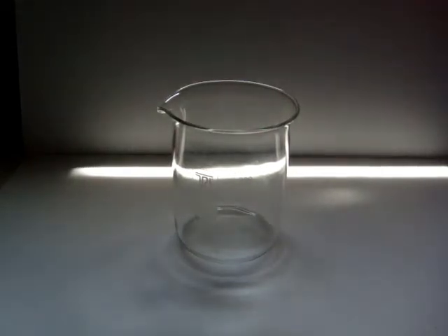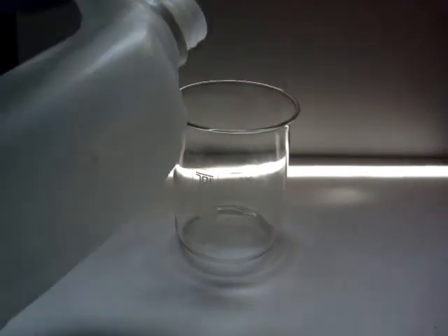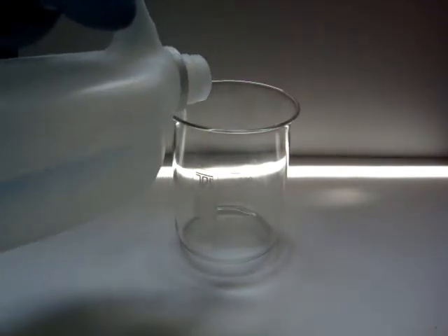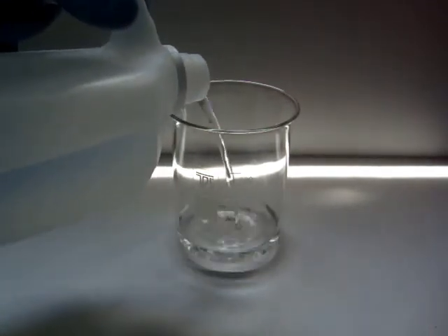Now let's get started. Put some water in a beaker or in a glass container. I am using distilled water.